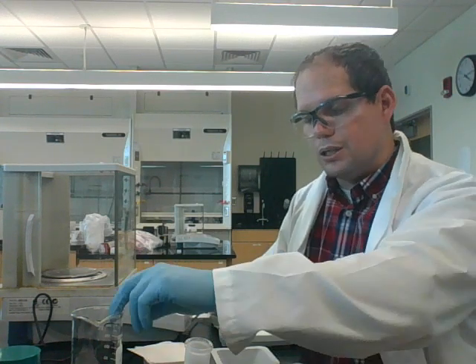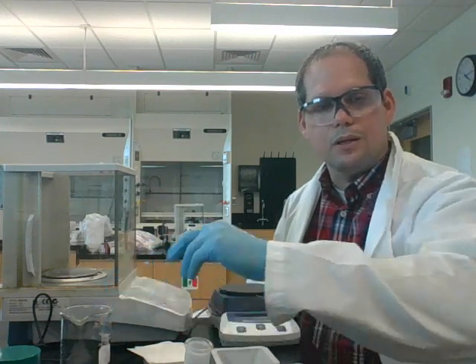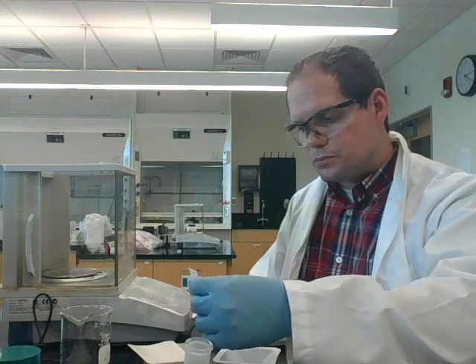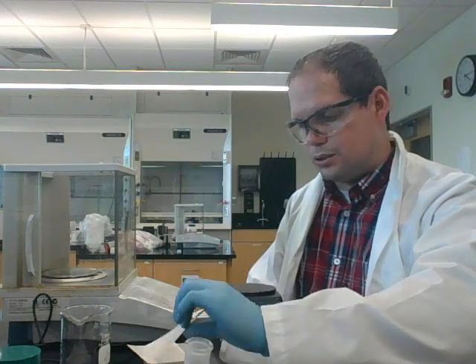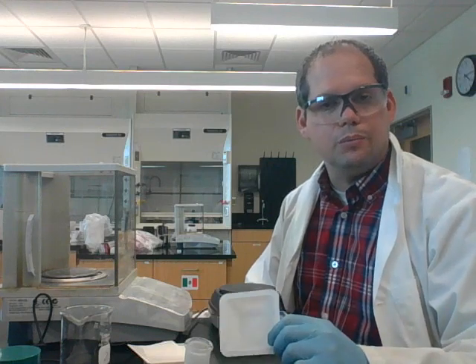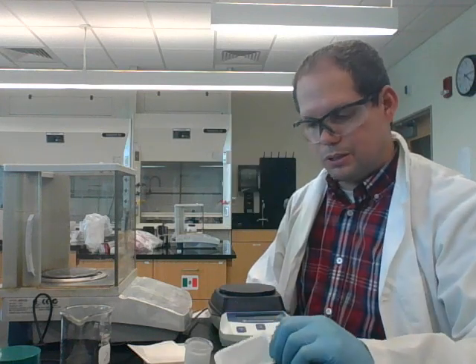As far as weighing equipment that you might use or glassware you might use, there are many different ones you can use. So often people will use beakers, so a simple beaker, but you could also use things such as weighing paper. Here's a single sheet of weighing paper, and there are also weighing boats that come in different sizes. So this is a little bigger one, and this is a smaller one.